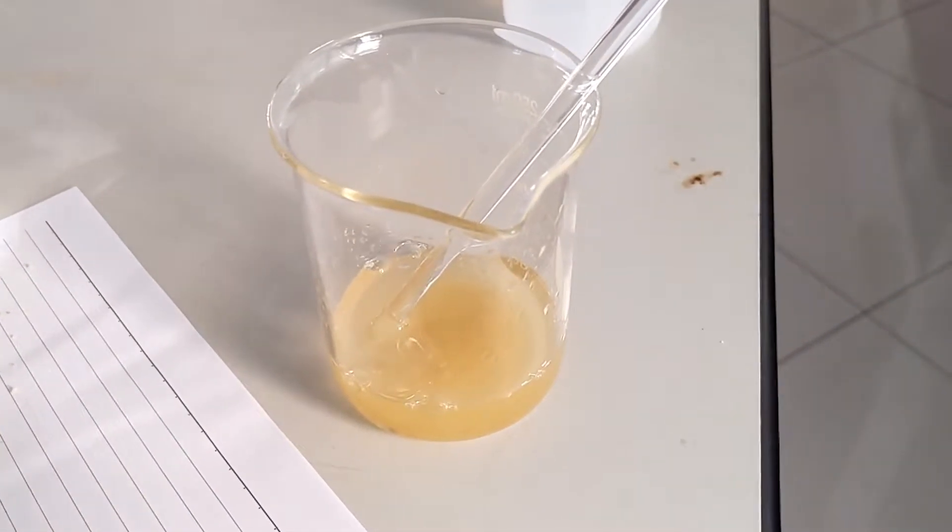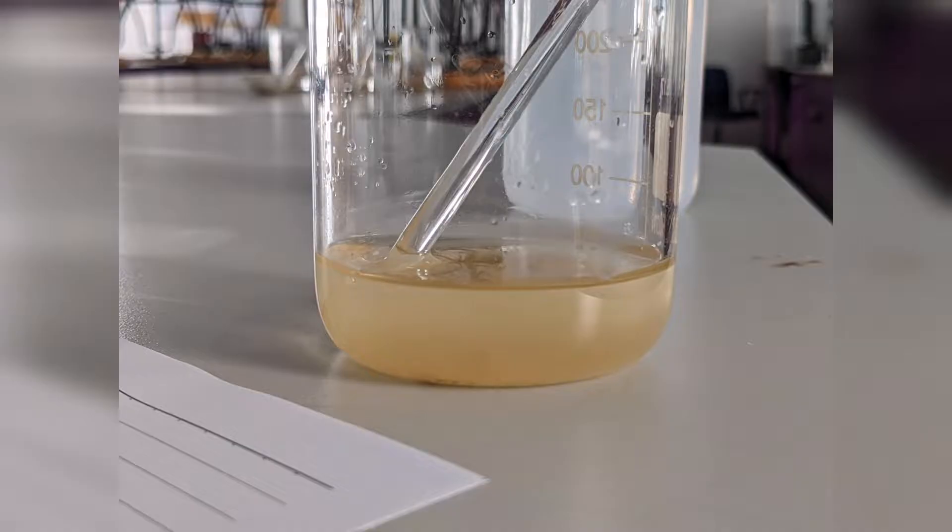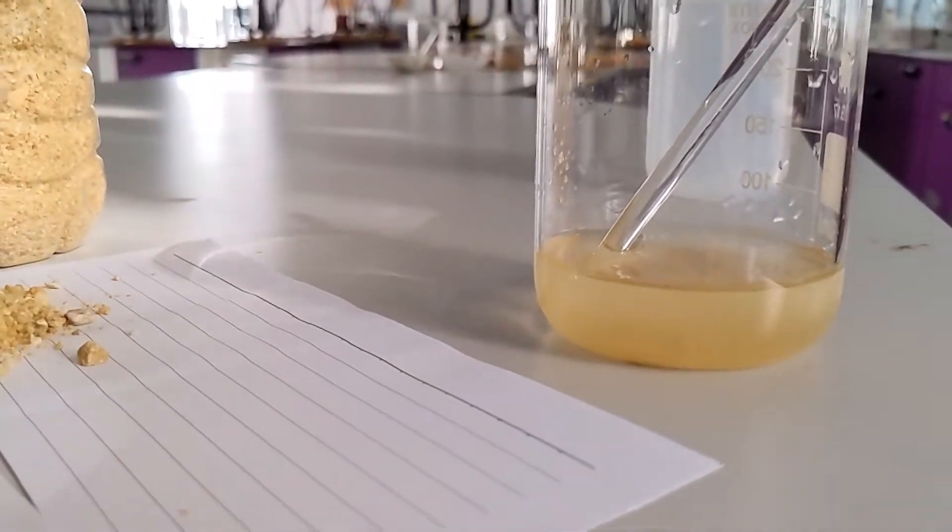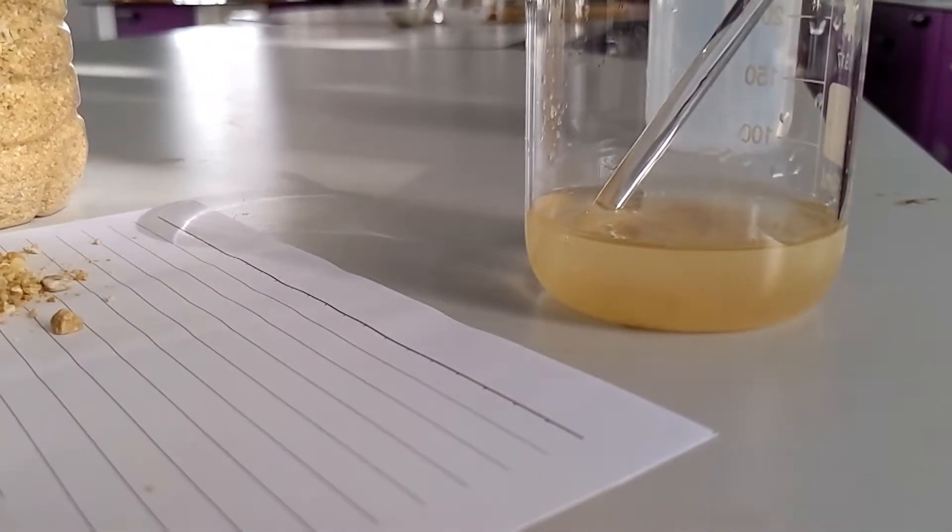Let's leave it to settle for a while. Here's our mixture of salt and sand and water. What do we do next?